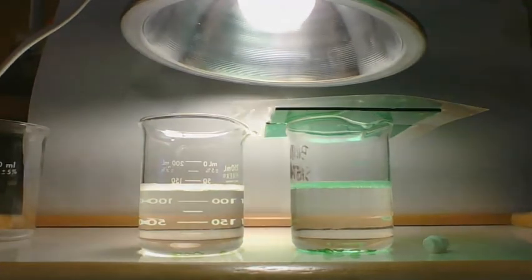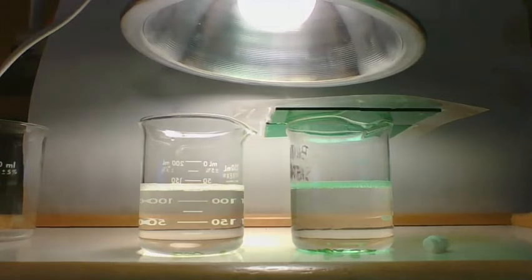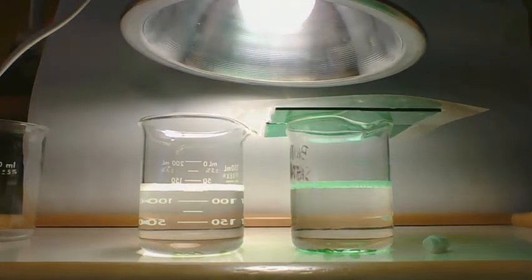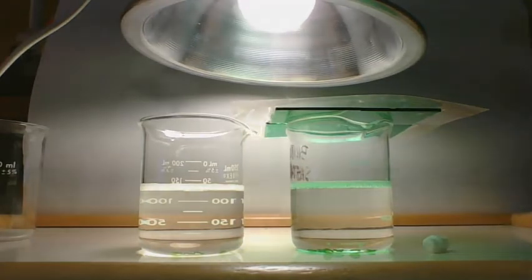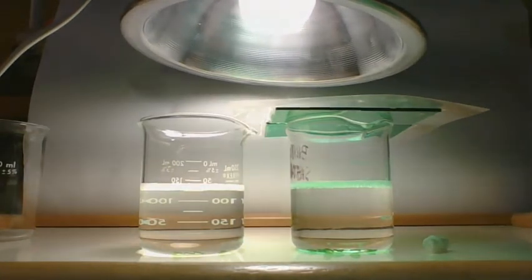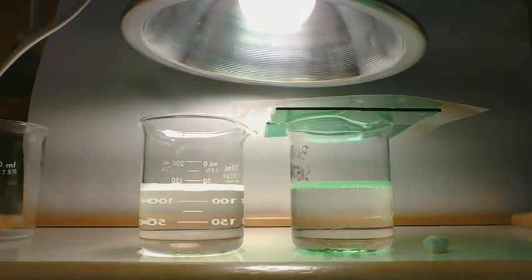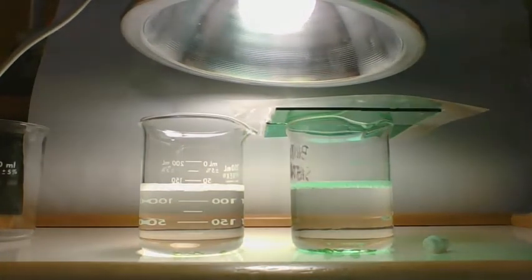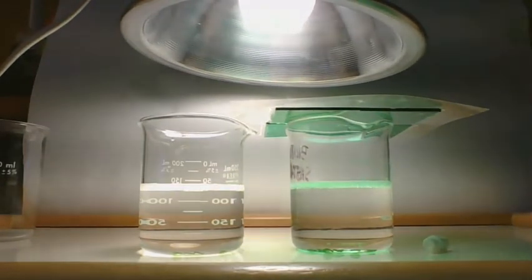If you recall from the activity, we did other labs talking about light. So some of you guys, if you picked this, may have already thought what was going on. If you look at the two containers, the one on the right, with the green filter on, is green. The water looks greenish, and the other one, the water looks whitish. That's because there's white light and green light.